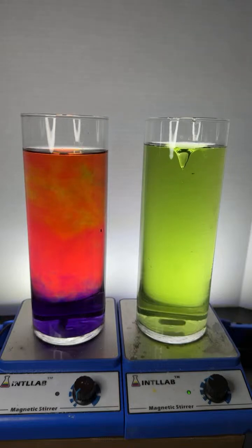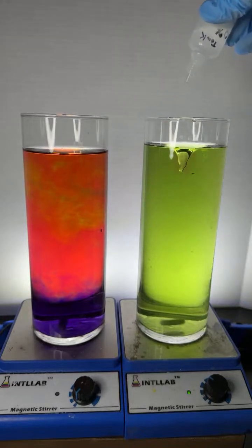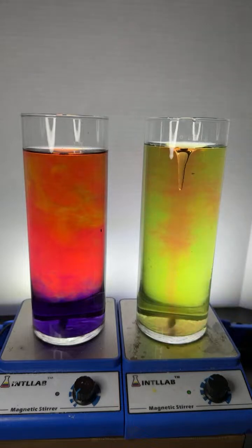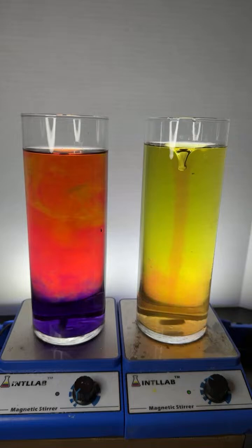You guys should know that this acid that I'm adding here is really concentrated so that we can get an effect. In other words, this acid here donates a lot of these. The difference between acids and bases is bound in electrical charge at its core at the atomic level. You can think of it that way, I guess. Acids are proton donors, H+ donors, and bases are H+ acceptors.